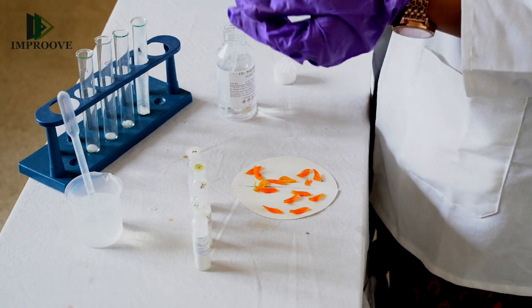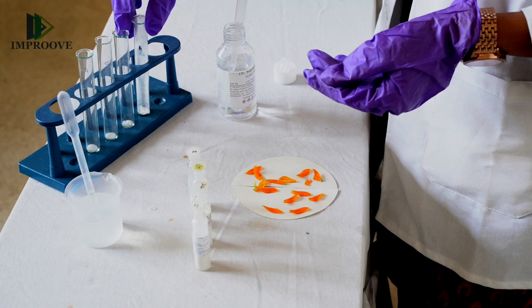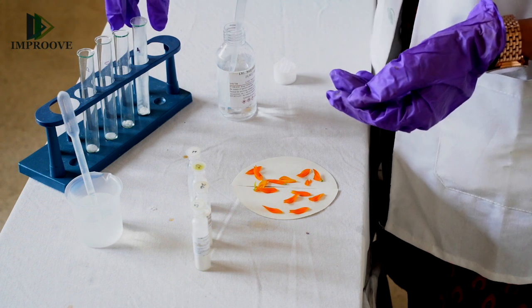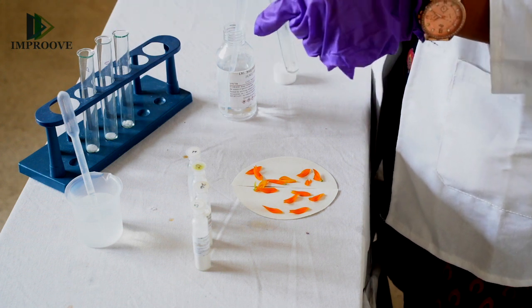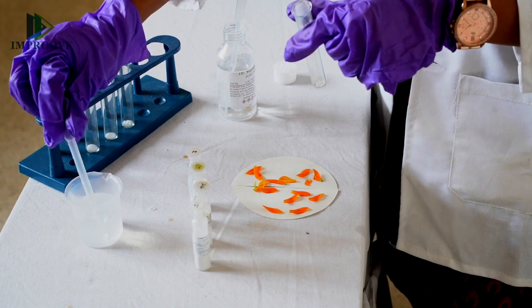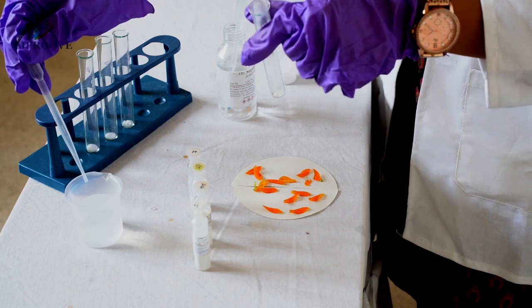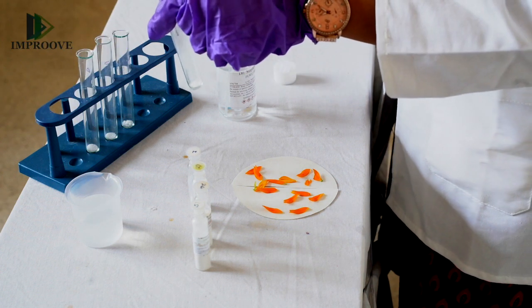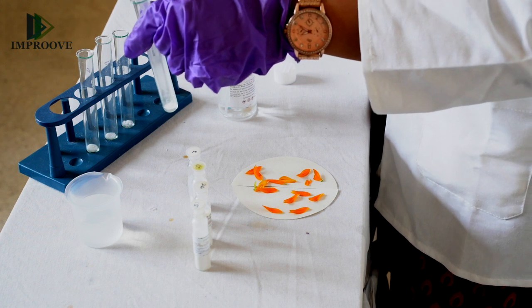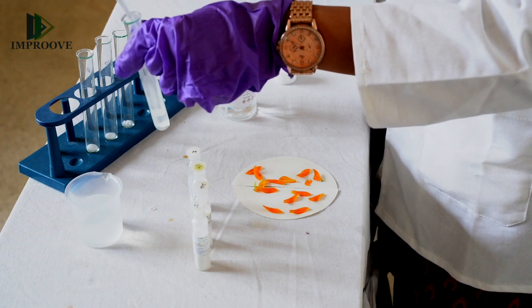To begin the experiment, after you have poured out the four salt samples in the test tubes, pick up one of them and add about 10 ml of tap water to each of these test tubes. The quantity of salt that we have taken is about 1 gram.